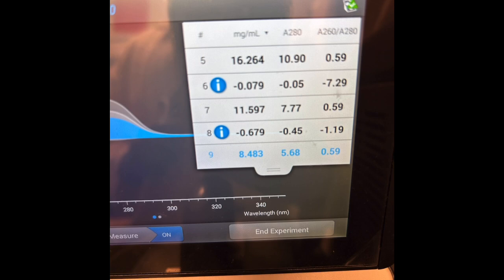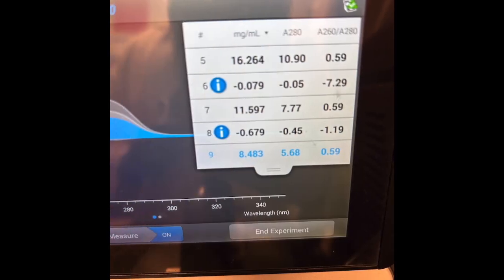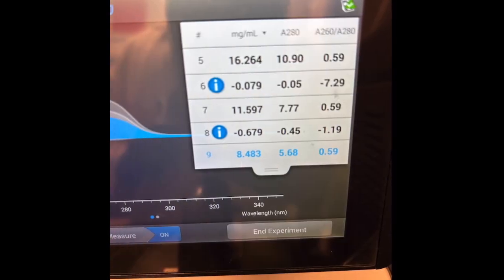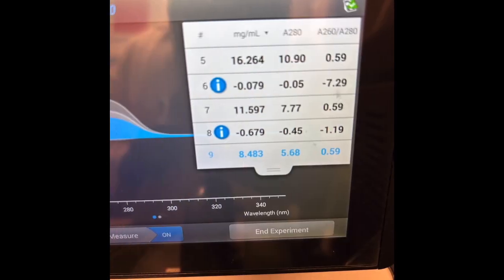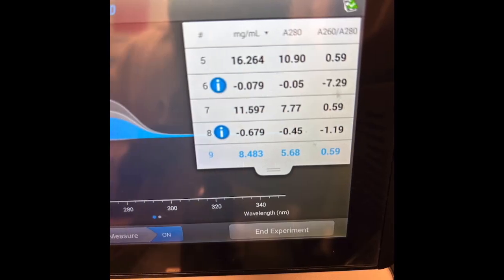My reading number 6, or the final A5, I believe, there was a mistake, which is why it shows about 0. But my first, number 3, was 16. My second, number 4, was 13. Fifth was 16 again. Sixth was a mistake. Seventh was around 12 again.